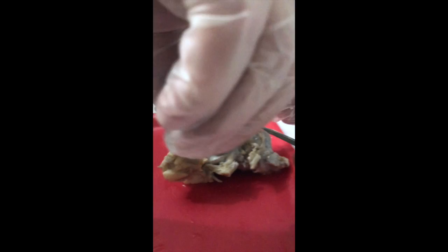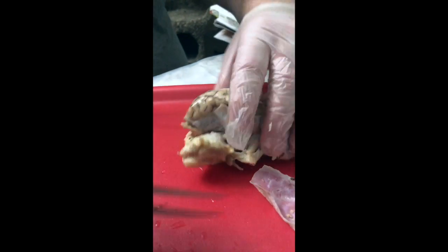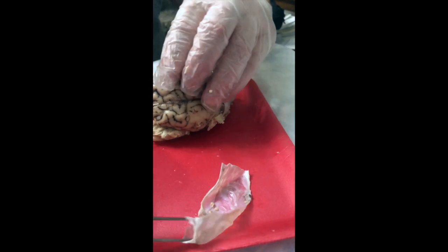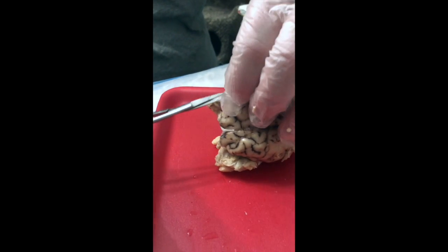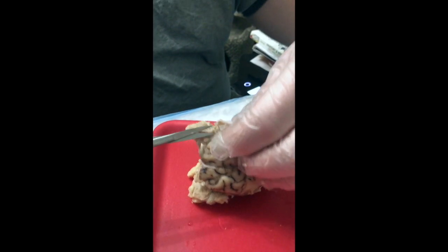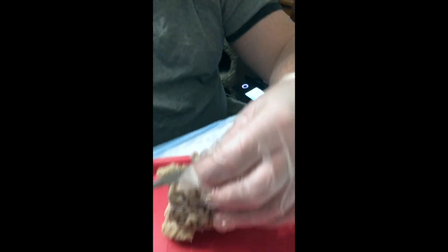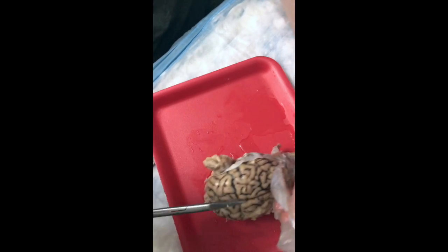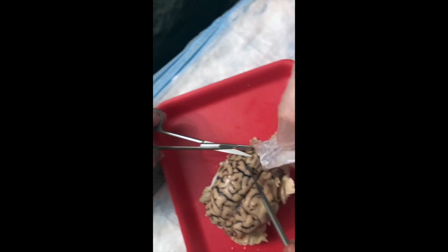Just cut that off for right now. And do the same thing on the other side. So here you're looking again at the two outermost layers of the meninges, and you can see that they are a structurally intact layer, fairly durable, hard to pull apart. Cut straight on. Don't go to the underside. So again, we're not cutting anything off of the inferior aspect of the brain so that we don't pull off any of those delicate inferior structures.